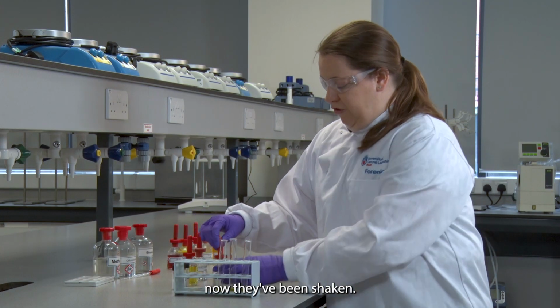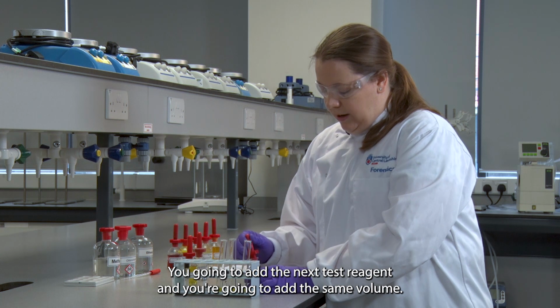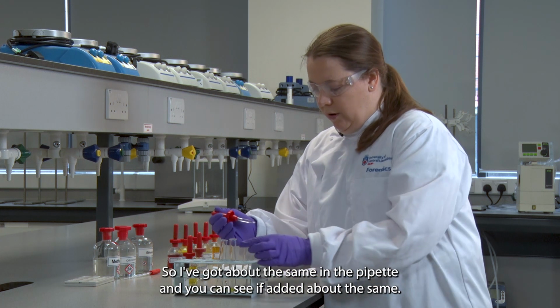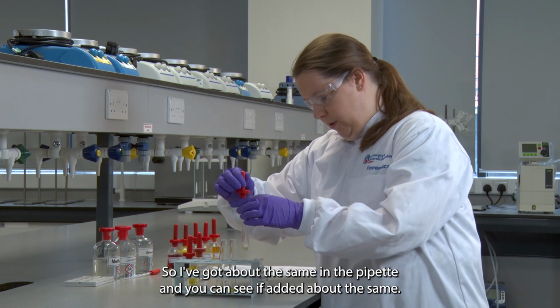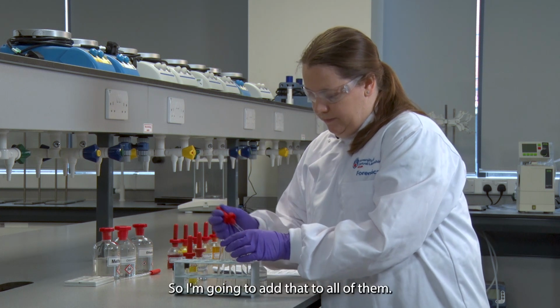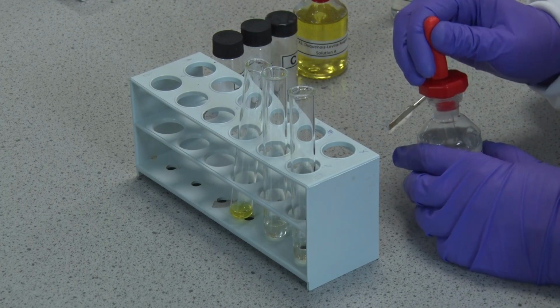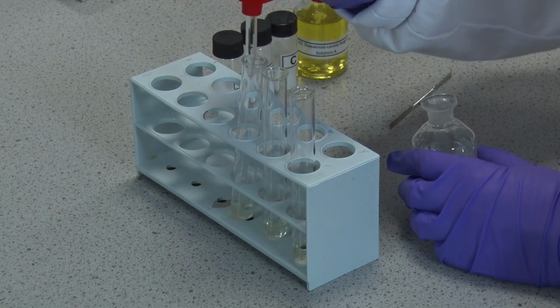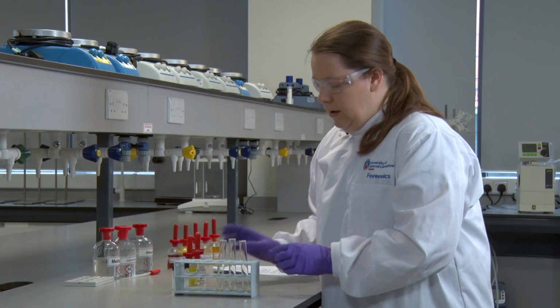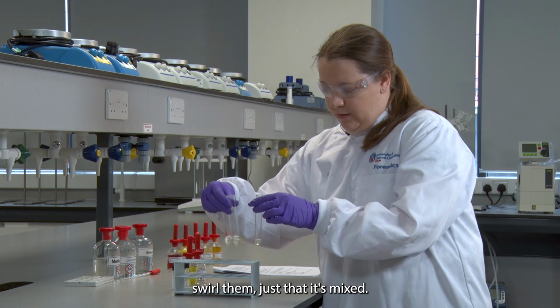Now they've been shaken, you're going to add the next test reagent, and you're going to add the same volume. So I've got about the same in the pipette, and you can see I've added about the same. So I'm going to add that to all of them. And then you're just going to gently swirl them just so that it's mixed.